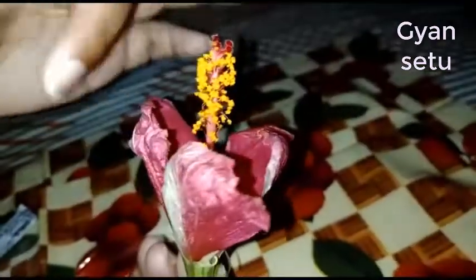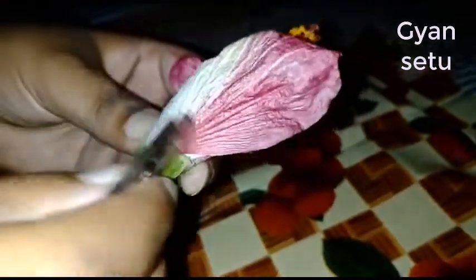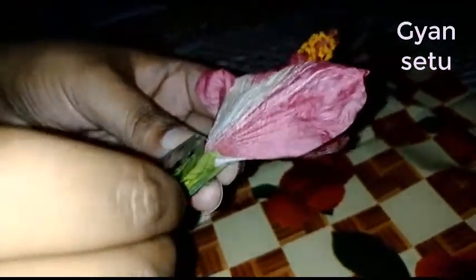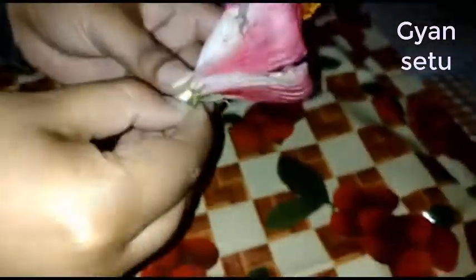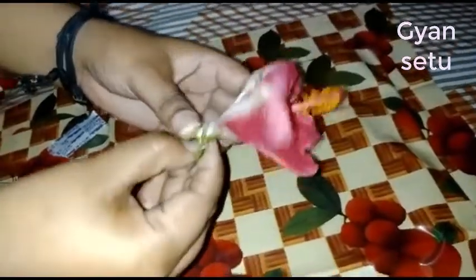The first step — I am just cutting it here and opening the sepals like this.